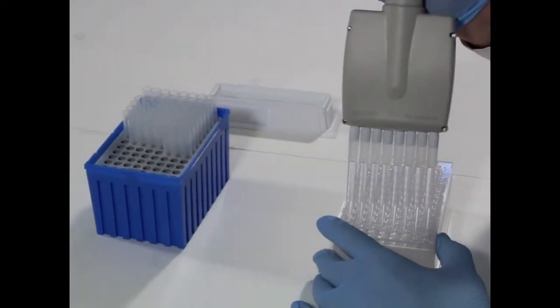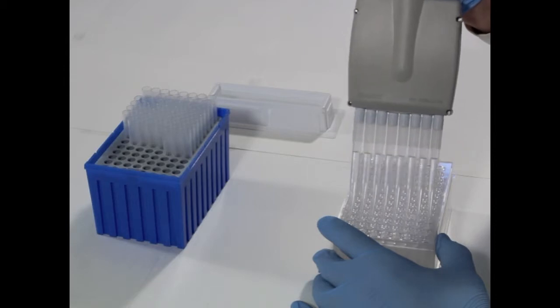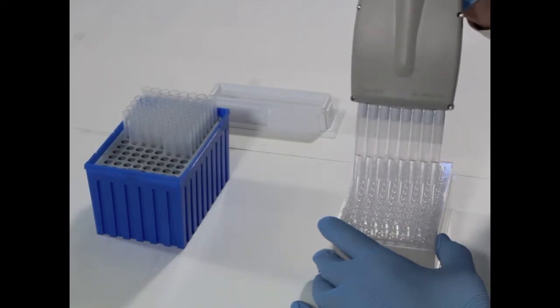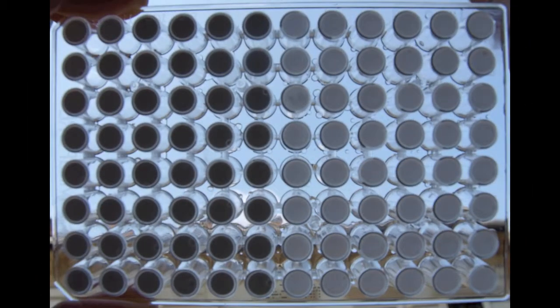Then, 200 microliters of hydration solution is added to each of the top plates and left to hydrate overnight. Complete hydration results in the membrane becoming translucent.